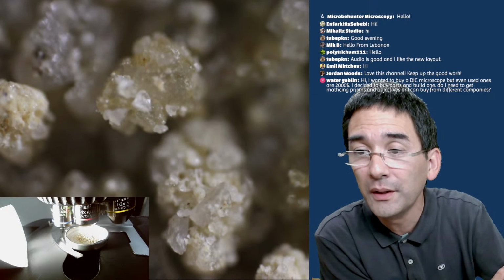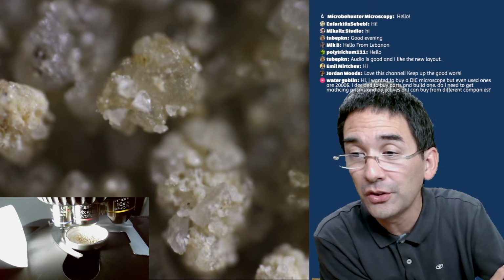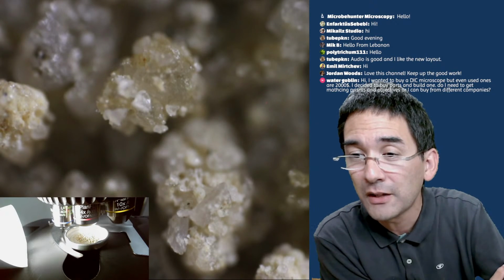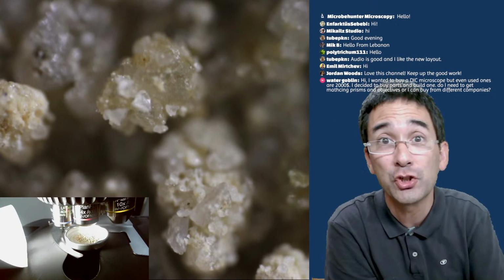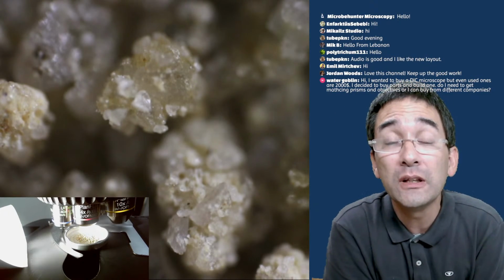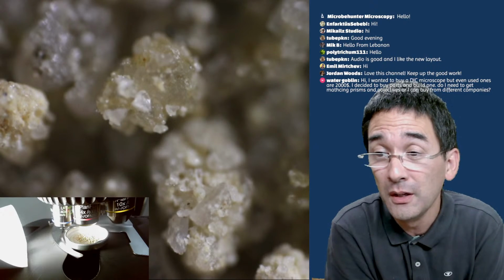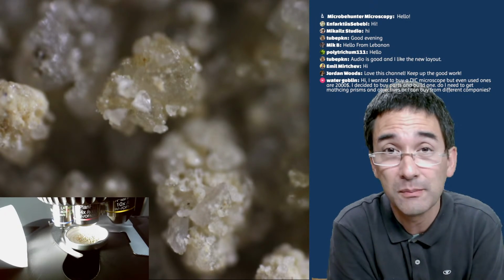Yeah, hi. I wanted to buy a DIC microscope, but even used ones are $2,000. I decided to buy parts and build one. Do I need to get matching prisms and objectives, or can I buy from different companies? No, this must be matching. DIC is differential interference contrast, and that's expensive. I know. You need polarizing, you need so-called Wollaston prisms, and so on.